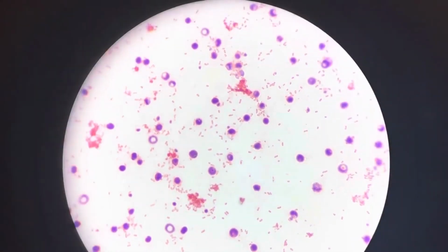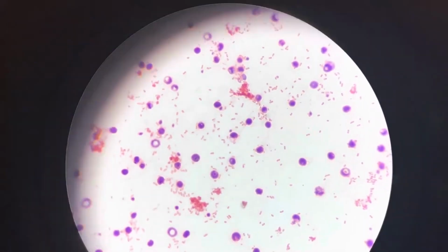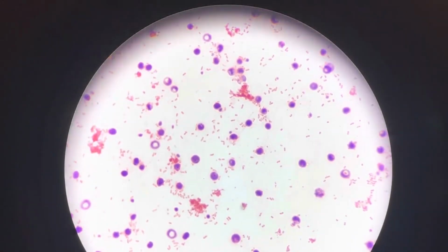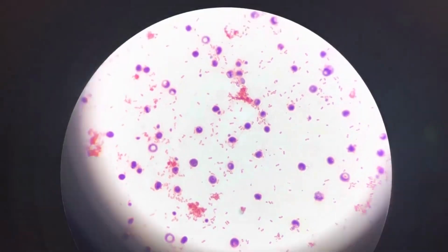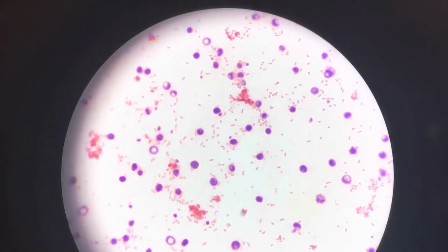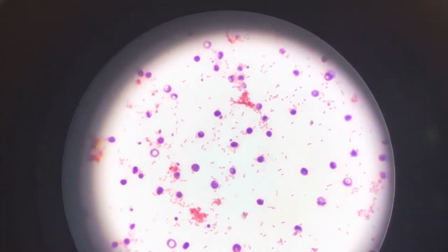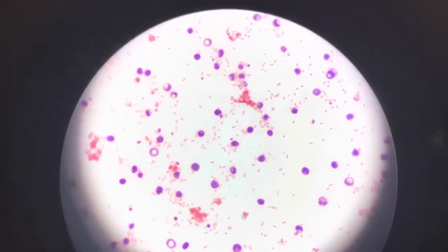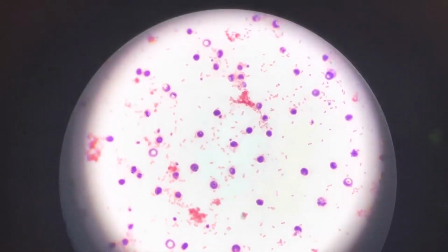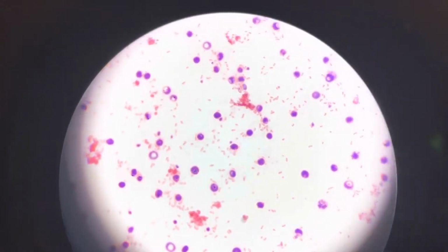Okay, so here's a good example of E. coli under the microscope with a gram stain. This is not the slide that I stained in the demo, but with this one you can see a little bit easier. These are gram-negative rods, which is E. coli, or can be E. coli, but this one specifically is E. coli. It's actually a blood culture example. You can see the gram-negative rods are rod in shape, and they are also pink, which means that they're gram-negative.